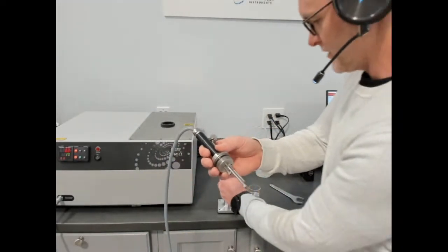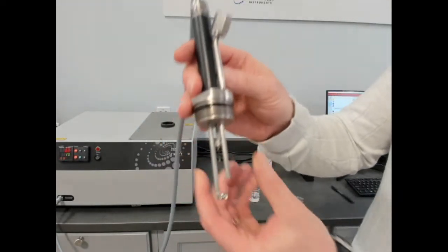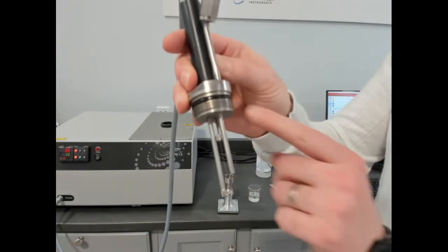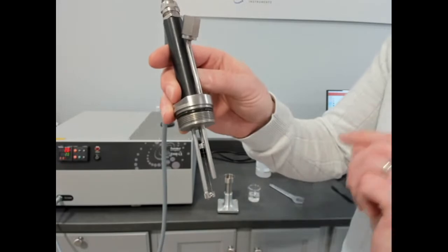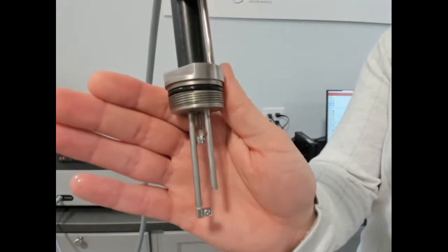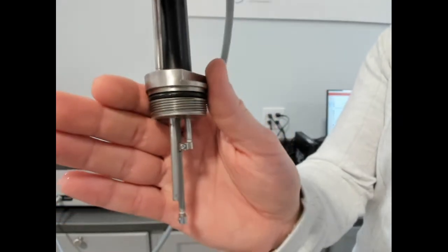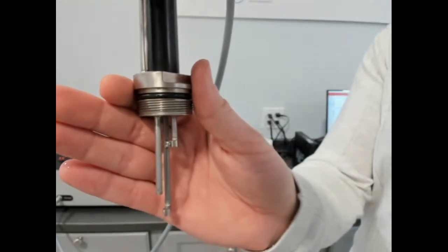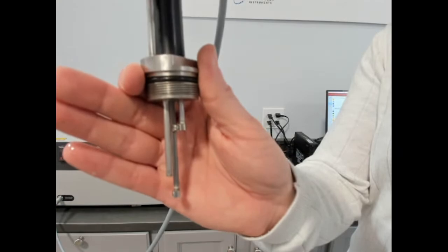The sensor itself is a platinum wire suspended between two contact points. You can see our contact points here. So if you break a wire, you can just use the set screw and change the wire and start measuring again. I will hopefully be able to show you a little bit. We'll do our best. It's a really small diameter, but there is a wire suspended between those two points. So hopefully you can get a visualization of that.